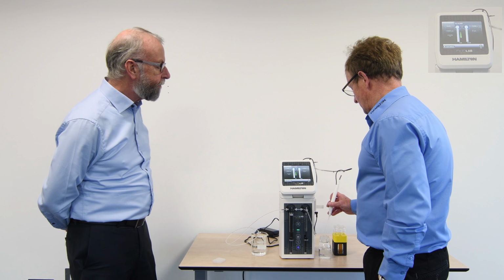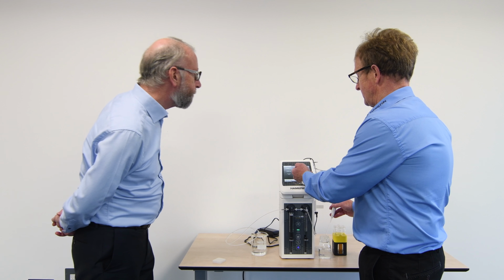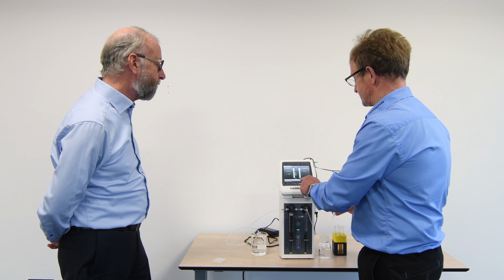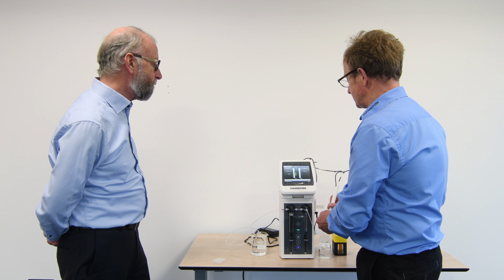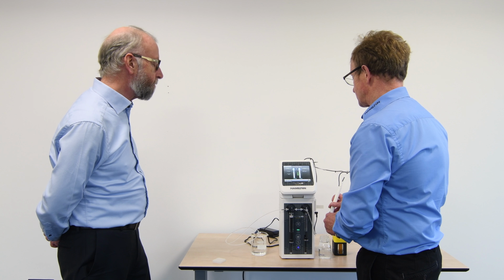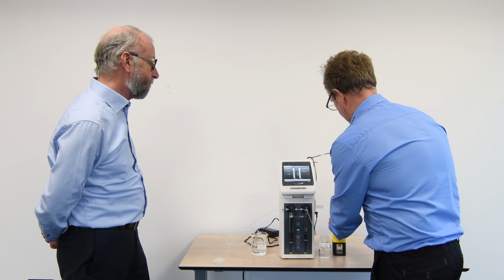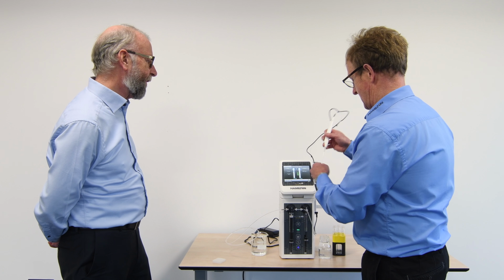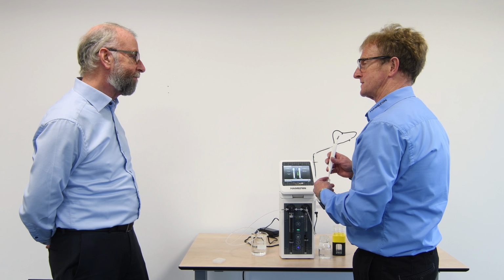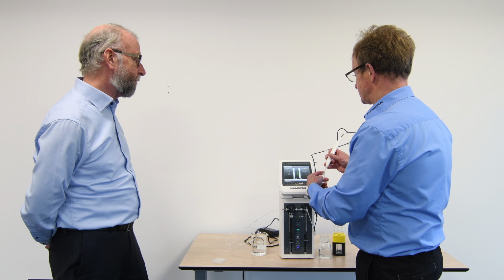Exactly. Okay. So the thing that we've actually done here is added some additional text lines. You remember the arrow is showing us here that we're going to be filling with diluent, but we've put a text line to say what that step is. So here, by initiating the first step, you can see it's taken the diluent, and now it's told the user what the next step is in terms of aspirating sample. So that makes it foolproof, really. Exactly. If the technician gets disturbed or has any other issues going on, it tells them immediately the stage they were at. So here we're aspirating our sample.